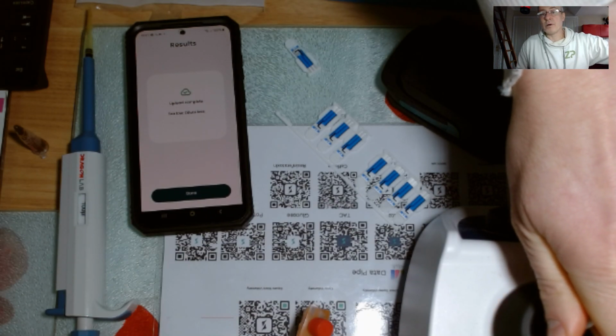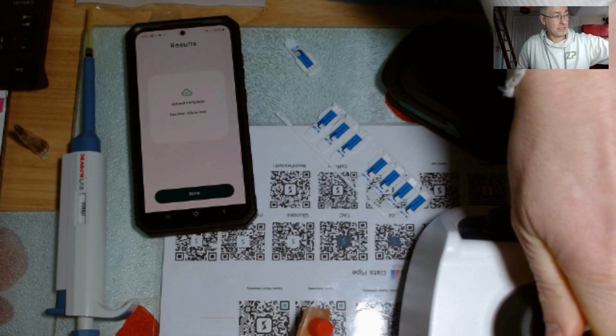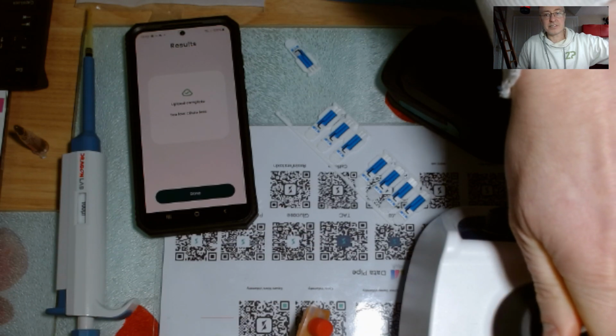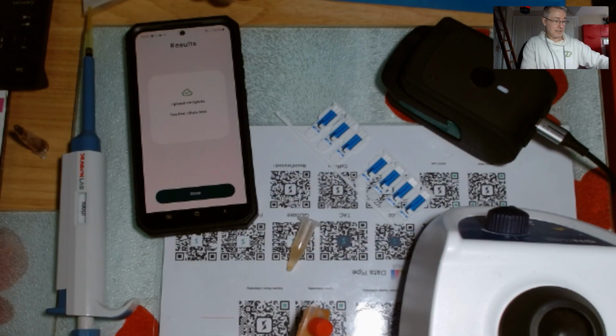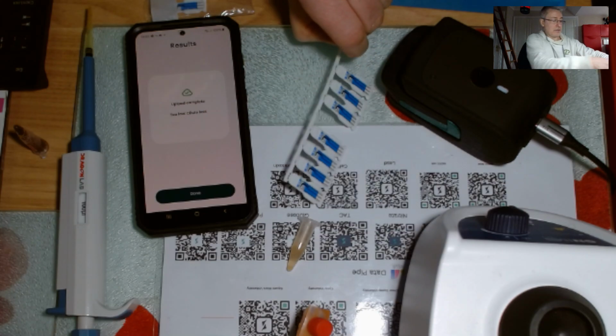Because I'm doing a live demo, or a live recording, I'm not going to necessarily spend as much time vortexing this, but for something like this, sometimes 30 seconds is just enough to get that. Right, so now I have it. Now I'm going to put a fresh sensor onto the unit. I've already got sensors out, so I didn't need to grab those ones. Right, let me grab a sensor.